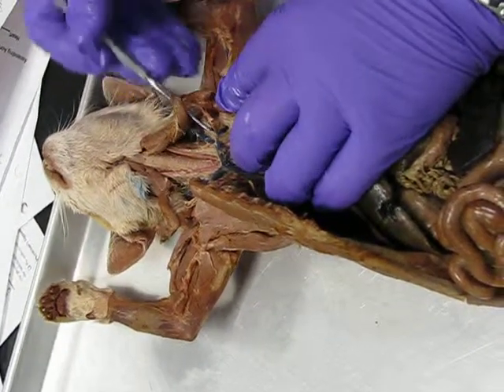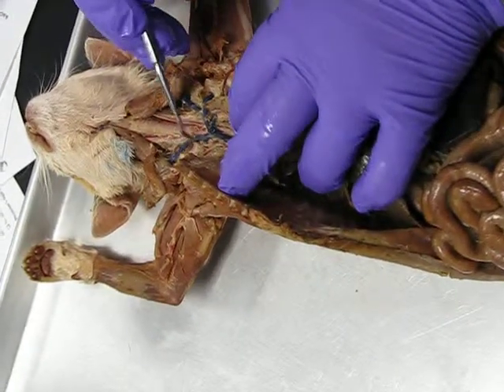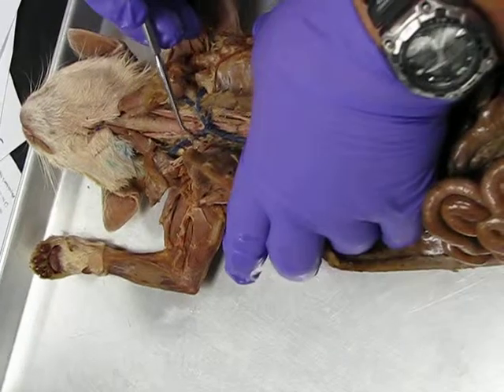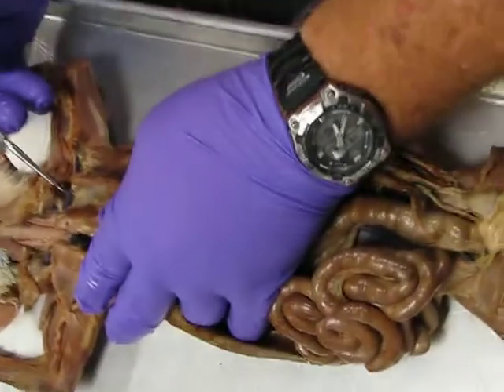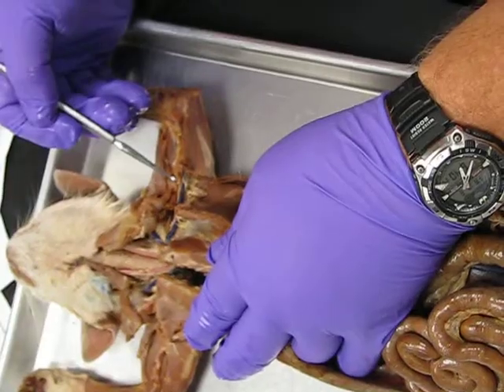That's the left side. Over here is the jugular going up on the right side, and the subclavian has been broken over there. But it would make a fork right there and go out. That's why he's dead. And the subclavian comes out, becomes the axillary, that becomes the brachial veins.